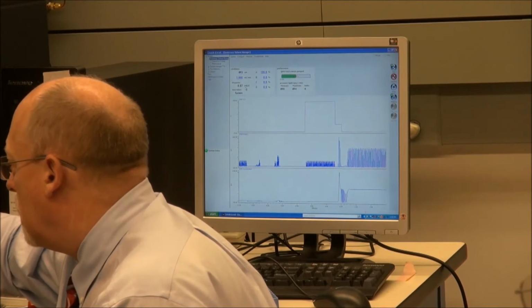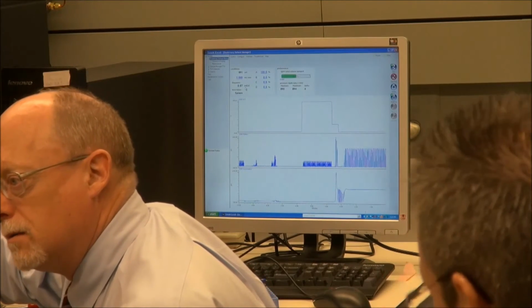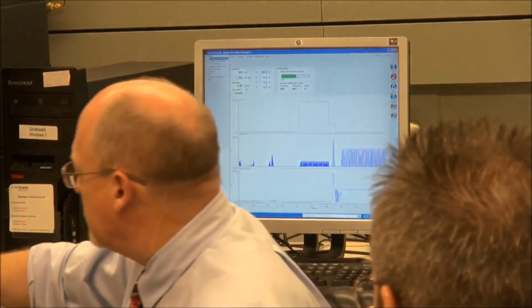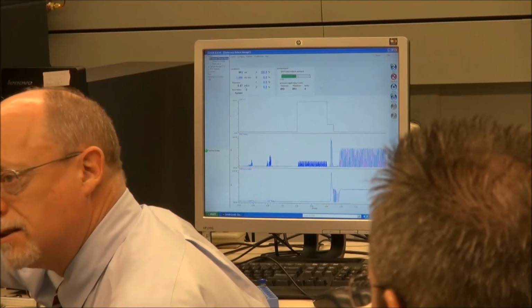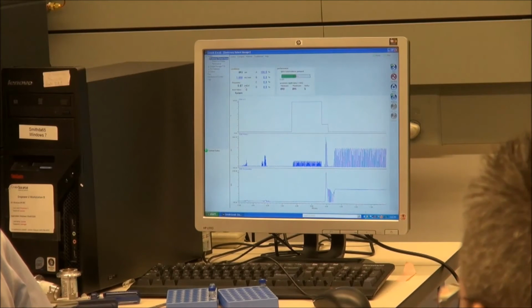So this is an interesting thing now. Feel that. Okay. Unfortunately, on an H class, this thing is so far over here that it's not really helping you much. But this is percussive right here, if I'm touching this. On an H class, your seal wash pump is here, while on a standard Acquity, your seal wash pump is here. And what will happen is, as this thing is percussing, it's like you taking a screwdriver and tapping your heads like that. So if you're trying to prime and you want to get the air out, especially in a standard Acquity, start your seal wash pump. Because it's like you doing that, and every time you do that, you're helping to release air. It's not moving anywhere, it's just oscillating back and forth.